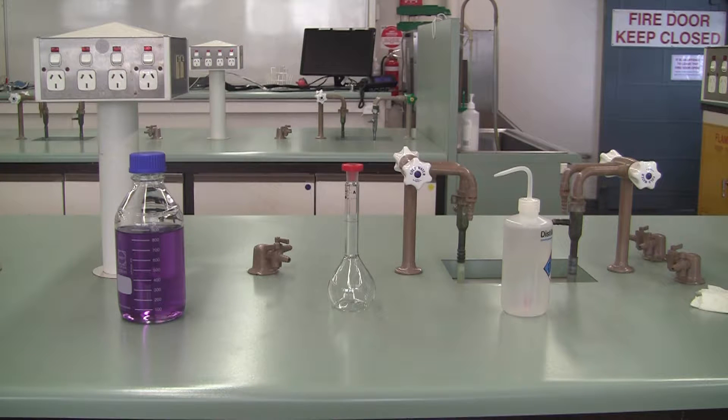We're going to take a volume of this purple solution and we're going to make it up to 200 mils using this standard flask. This method applies for solids, liquids, whatever you like.